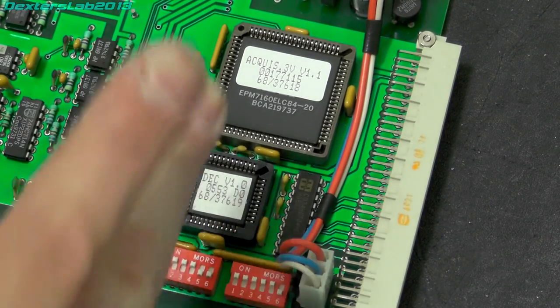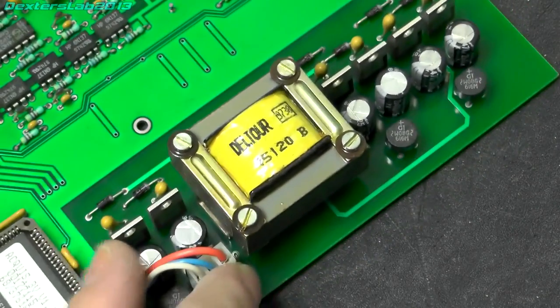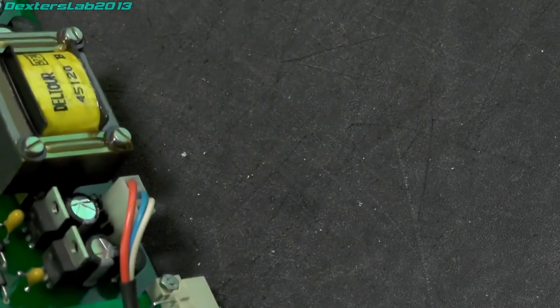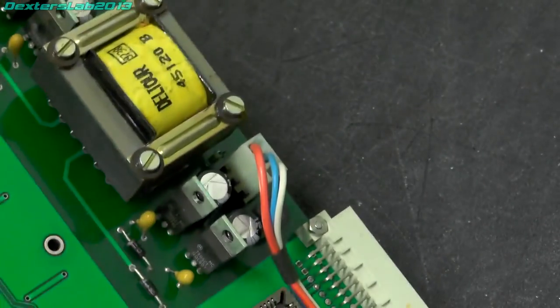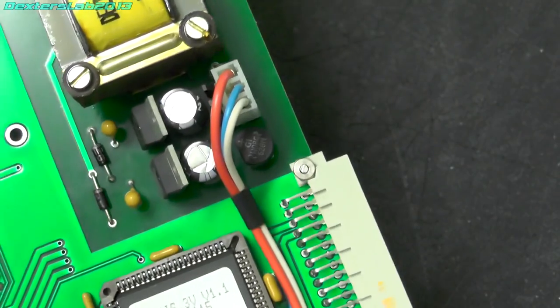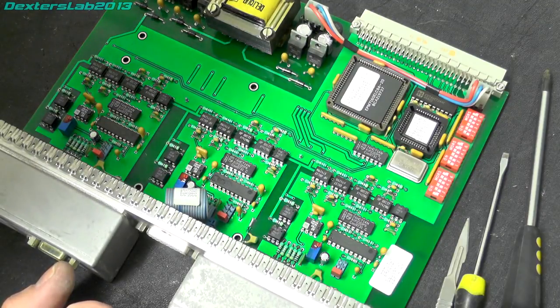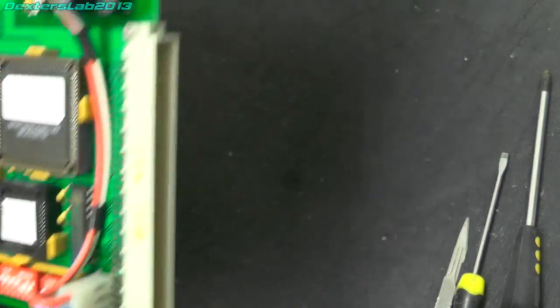Got a 16 megahertz oscillator there. Yeah, again, like the other board, we've got local voltage regulation. We've got quite a few going on there. Let's have a quick look. 7905, 7805, 7905, 7805, 7905. So, yeah, we've got separate plus minus 5 volt rails. Plenty of date codes on these. So, this dates this to 1997. I wasn't too far out when I said late 90s.